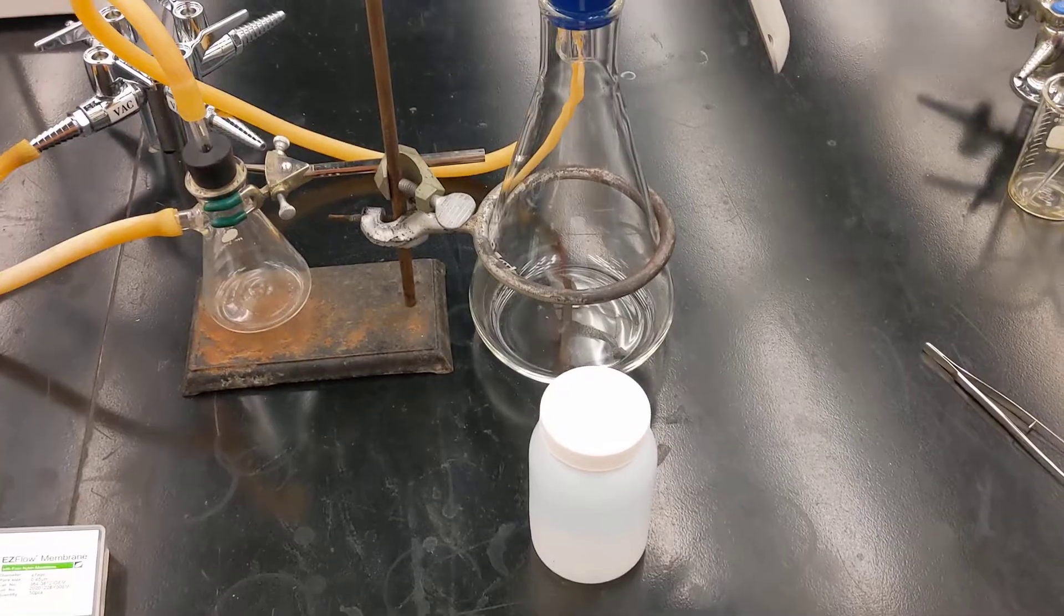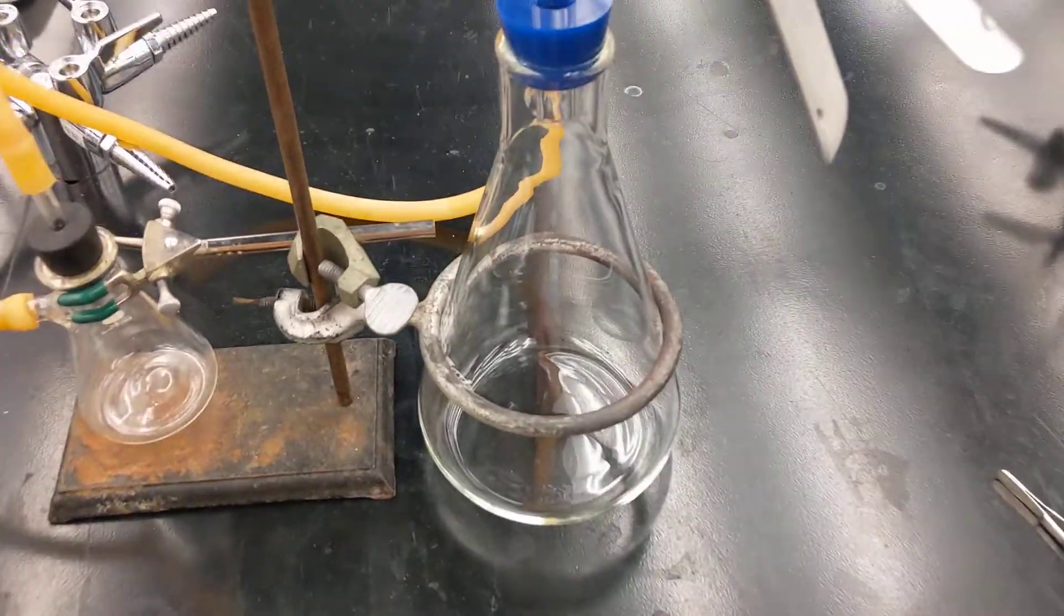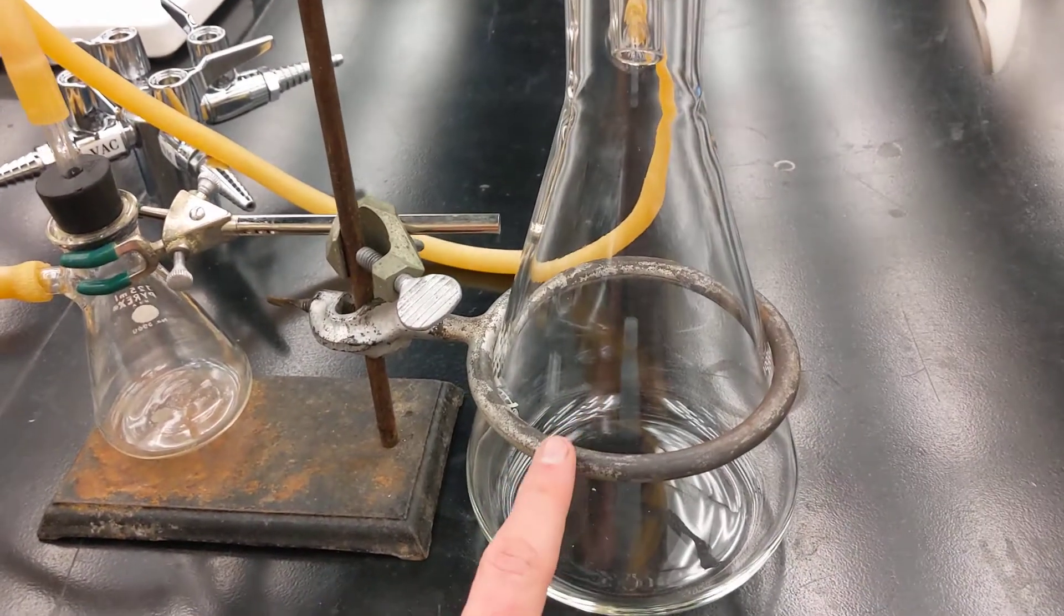To actually do the filtration now, you'll want to do one of two different things. It just depends on what you have, what the cleanliness of this object is, since this is collecting your fluids.